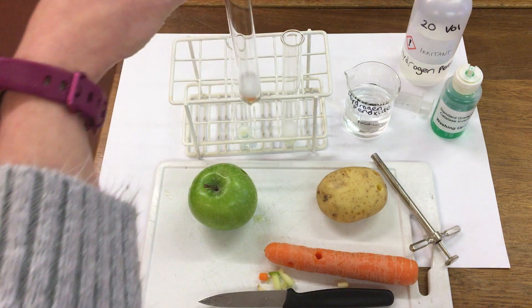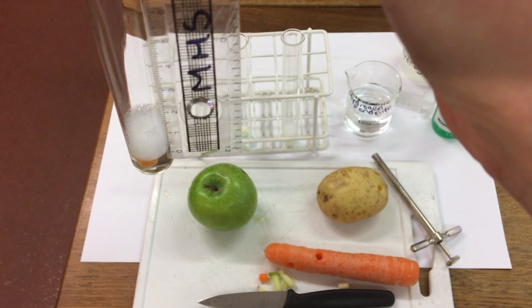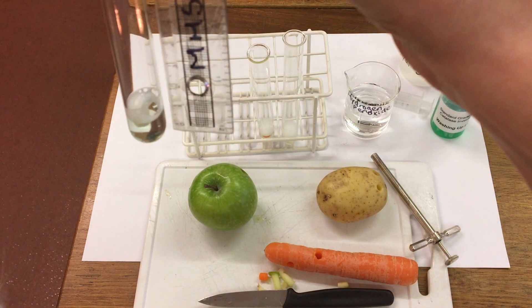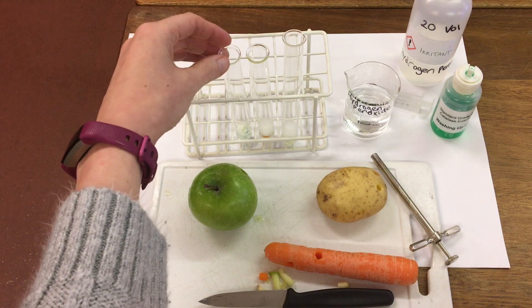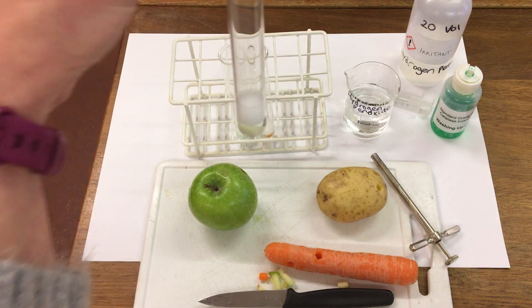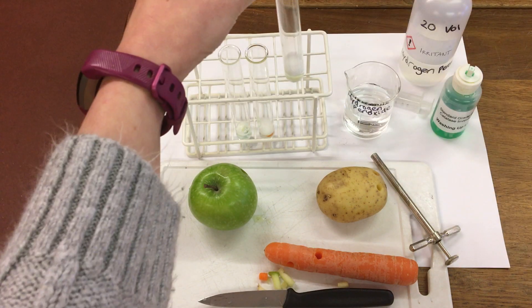In our second one, that was the carrot - we've got 1.2 cm. So the apple was 0.6 cm, and 1.2 cm in the carrot. And the last one, the potato - we've got 1.5 cm on that one.